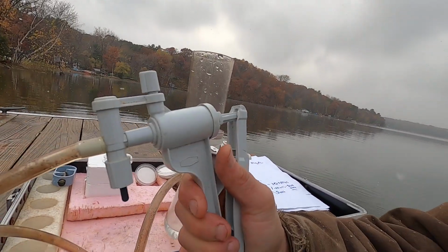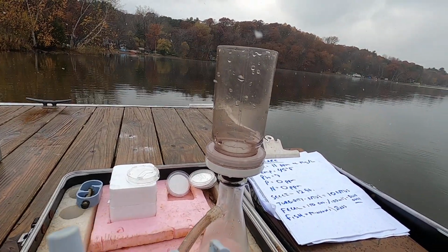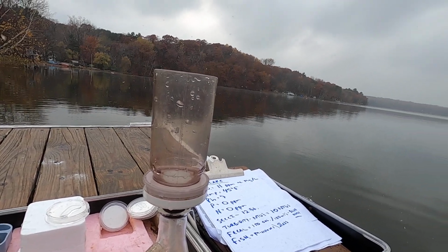So what will happen is impurities, sand, silt, algae, anything that's in the water making it cloudy will get caught in that filter. And what's really cool is the bacteria are also getting caught in that filter. Still pumping, still dripping. So I've just about got all the water across my piece of filter paper.